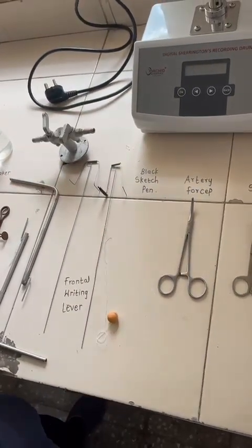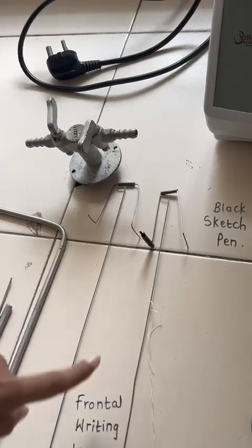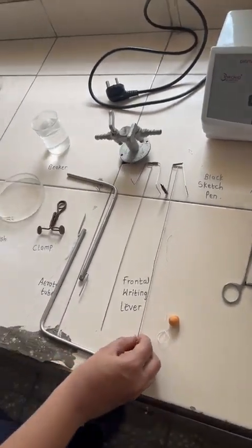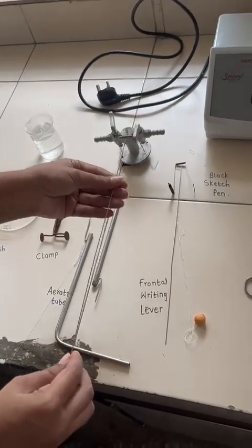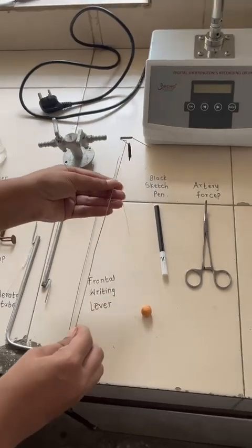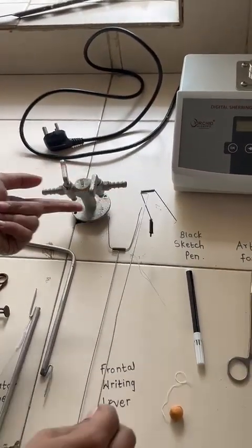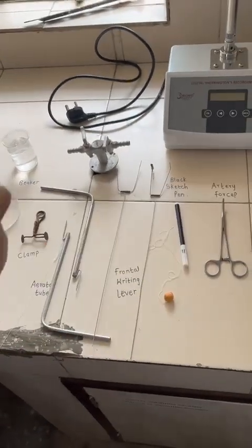Then the black sketch pen. Here we are attaching the black sketch pen directly to the frontal writing lever. This is one of the levers that we are going to use during the bioassays. Here is the normal lever, and here we can see there is an attachment of the sketch pen to the tip of the lever. Again there is attachment of load with the help of clay.